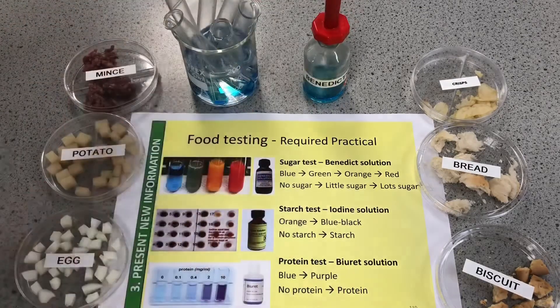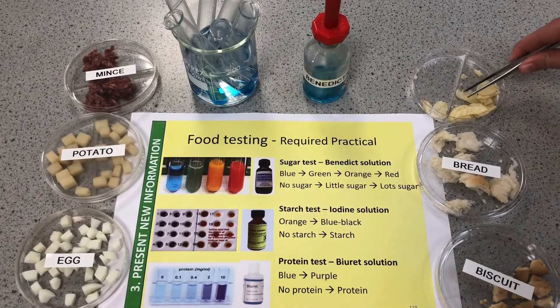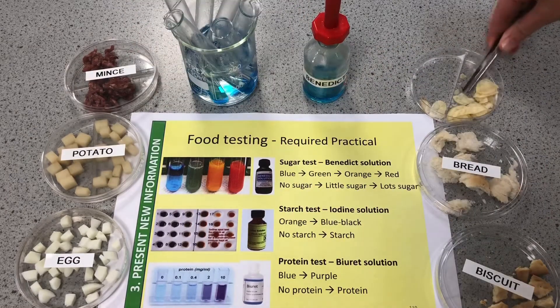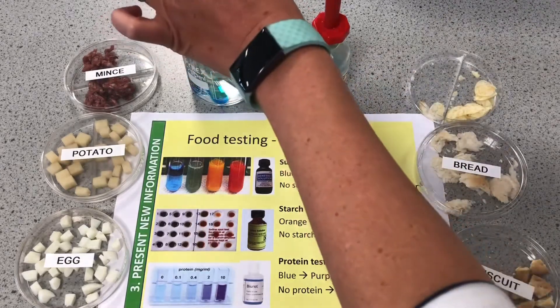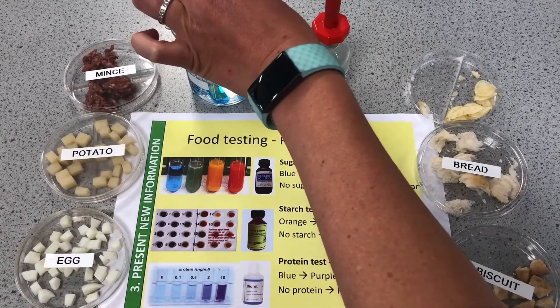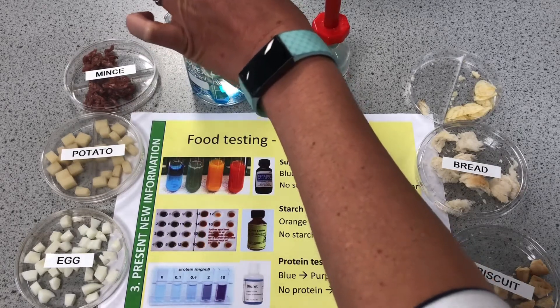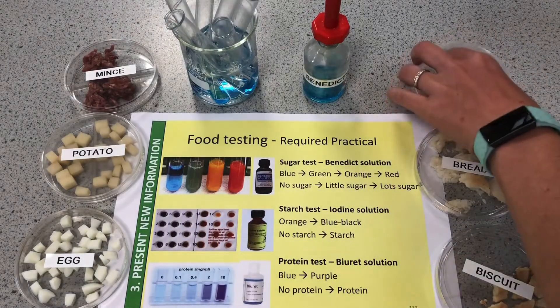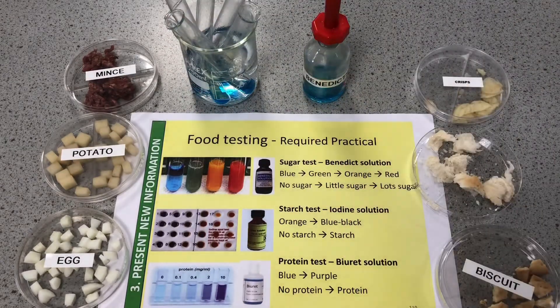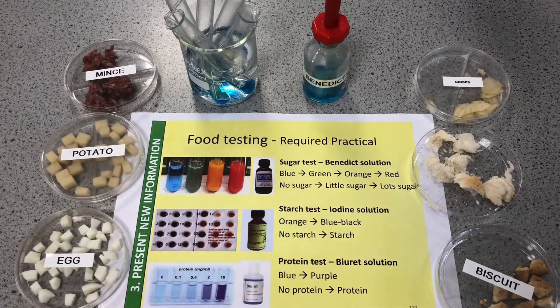We're going to leave this for probably about 20 minutes before we get those color changes, and then we will come back to it. Hopefully we'll have those color changes and we'll be able to see how much sugar there is in each of these foods.